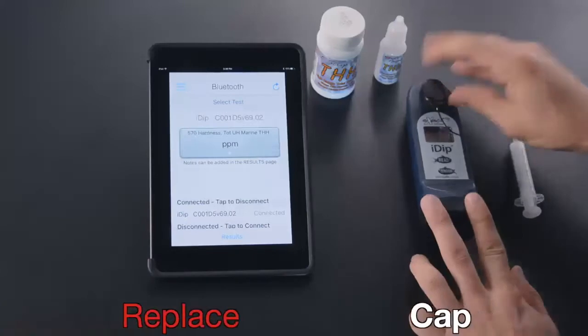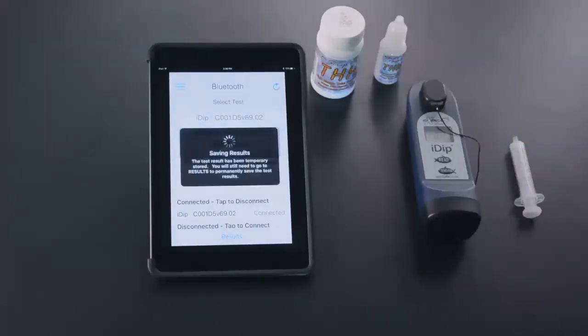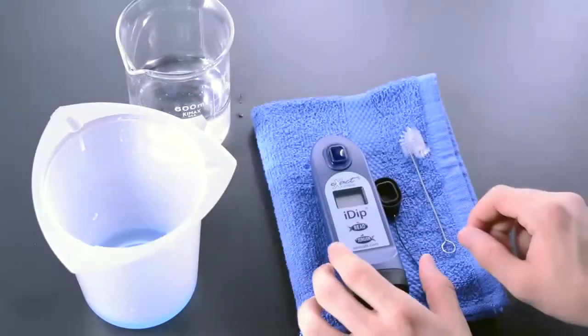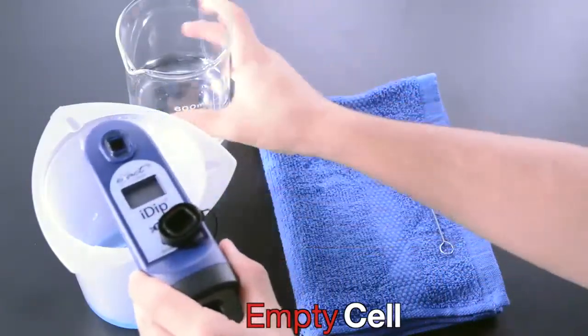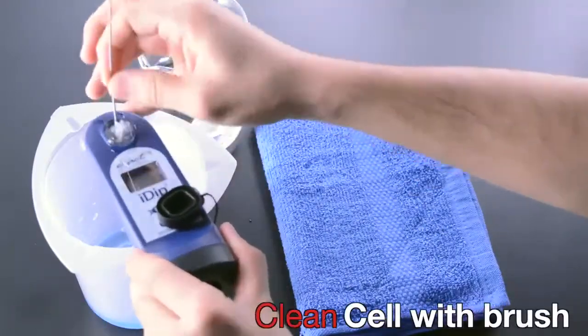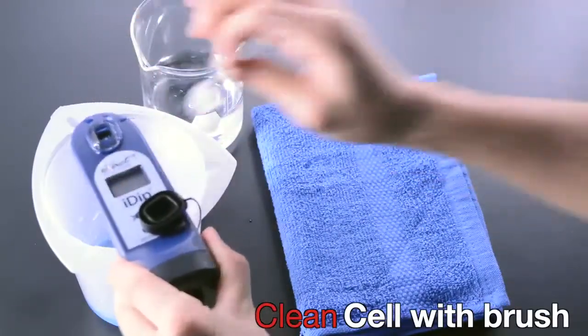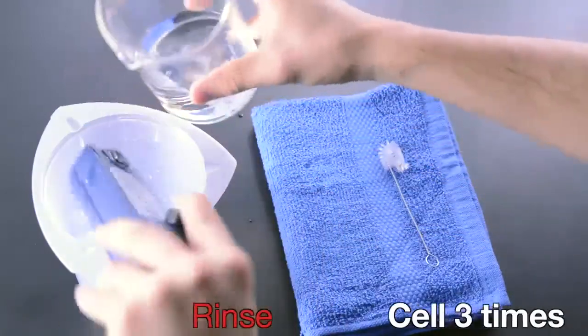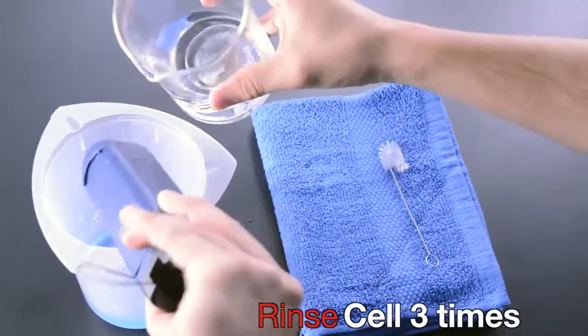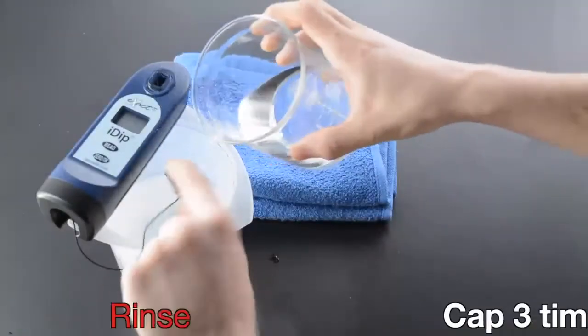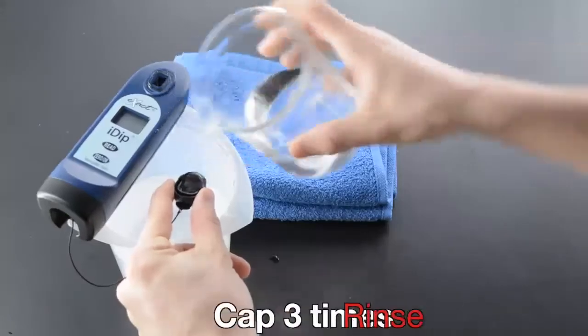Replace cap, read result. Empty cell, clean cell with brush, rinse cell three times, rinse cap three times.